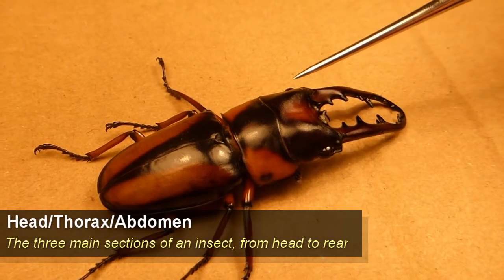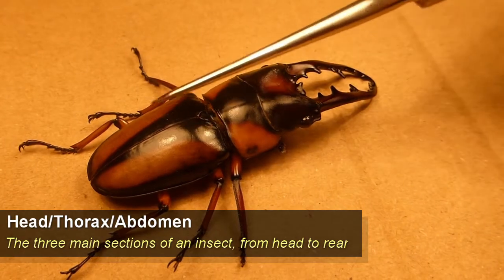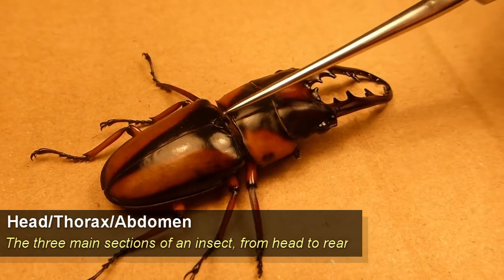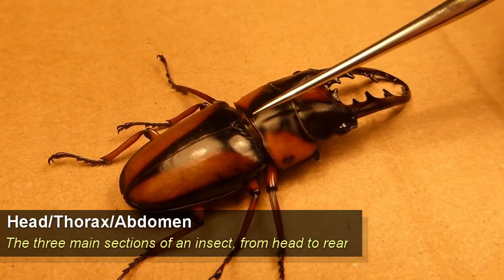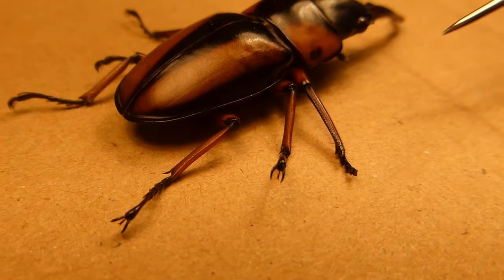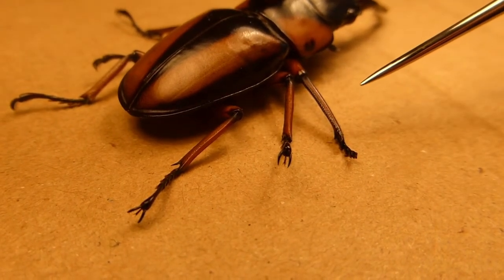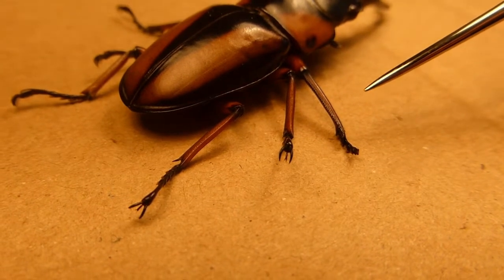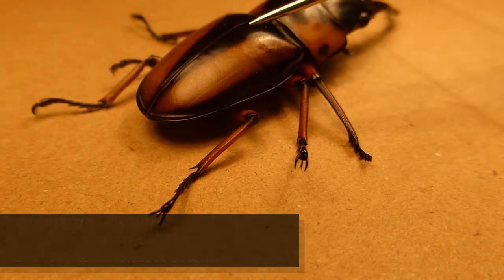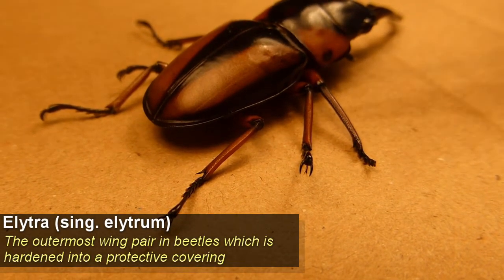The beetle is split into three sections: the head, the thorax, and the abdomen. This top bit here is called the pronotum, and this small vaguely triangular-shaped bit is the scutellum. As in all insects, beetles have two pairs of wings hidden underneath and three pairs of legs — six legs in total. The outer pair of wings are hardened to form elytra, this shell-like structure over the top, and the flight wings are underneath.